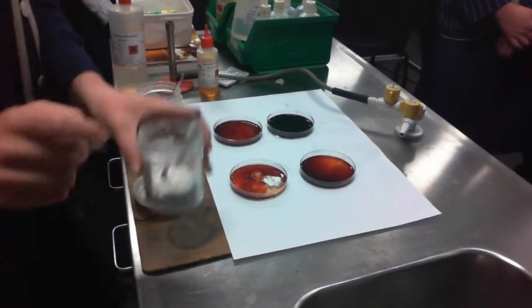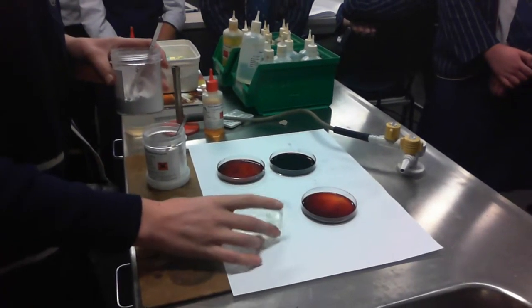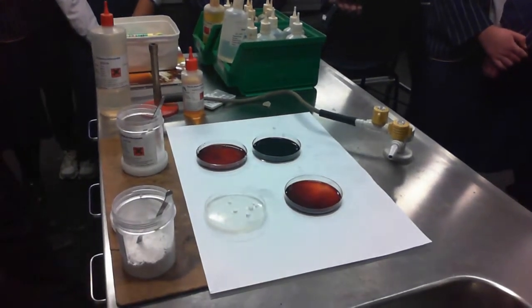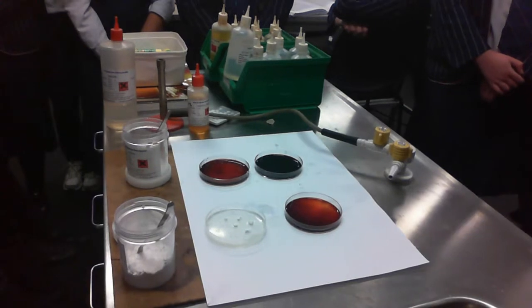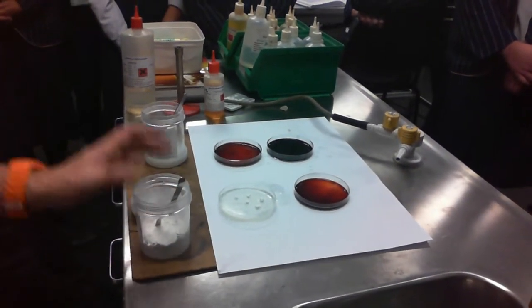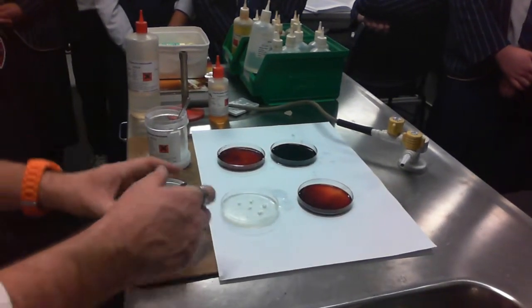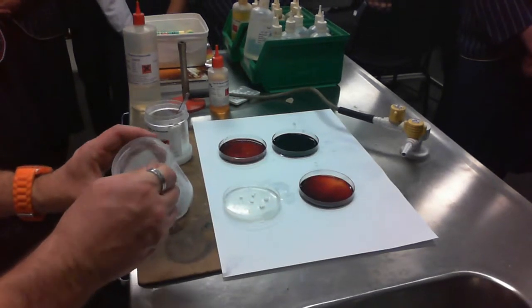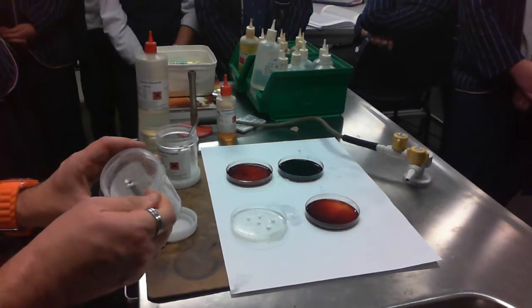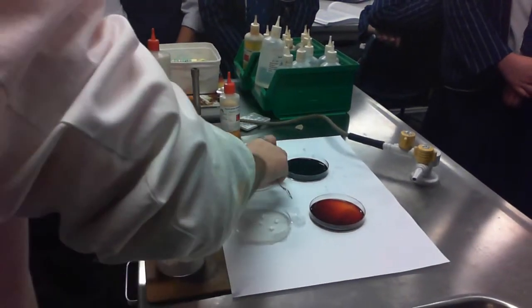Yeah. And here we can see that it'll probably go colourless in this case, because we've taken it so far that we've actually bound all of the iron 3 ions out, and there's probably none there at all. So we've actually destroyed the equilibrium in this case. If we added only a small amount, the colour would just fade as a new equilibrium is established. All right, so I'll just show you what I mean by just a little bit on our control. Oh, don't be sorry. There was an apology there, but it wasn't needed. It was quite exciting to see it go the whole way.